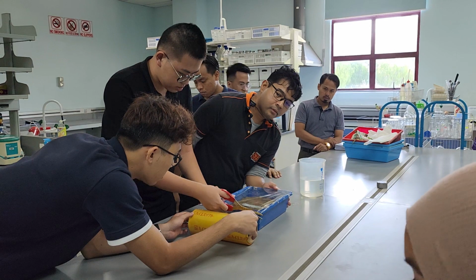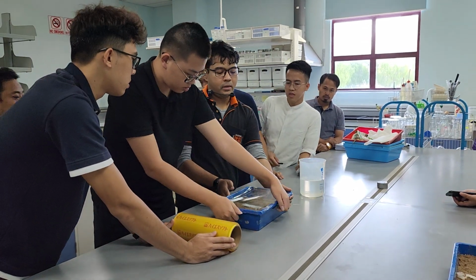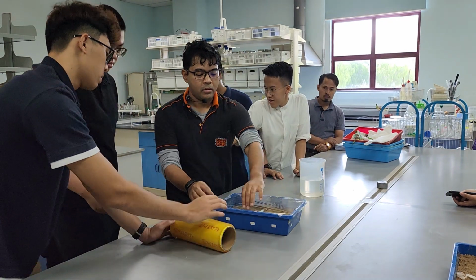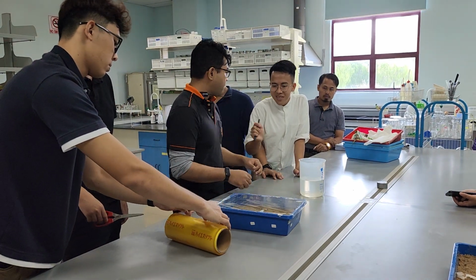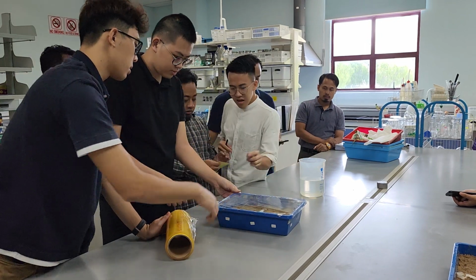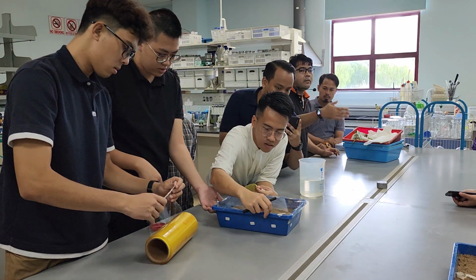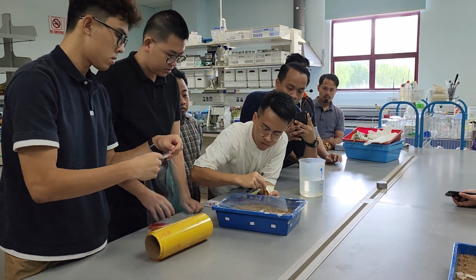Are you okay? Okay. Do one way. I don't have the label. Oh, label. Sorry. That's not label. So you need to put the label for both sections, for T1 and T2, which is week 1 and week 2.